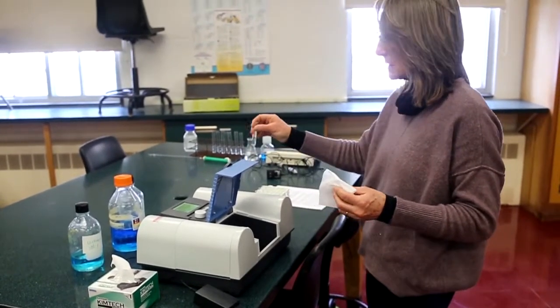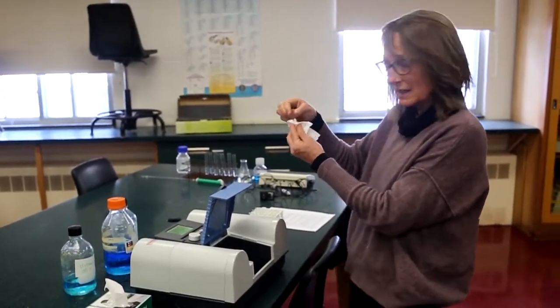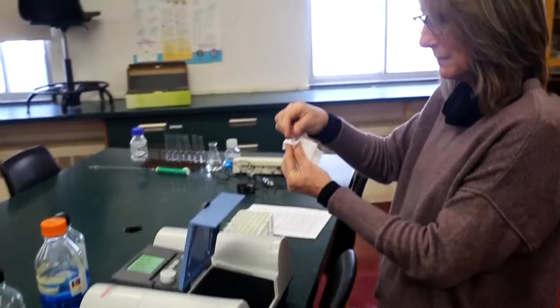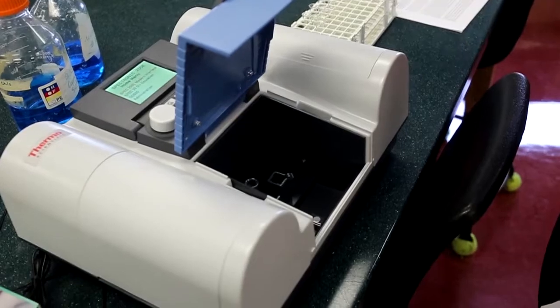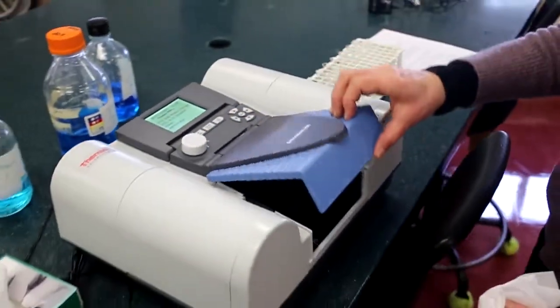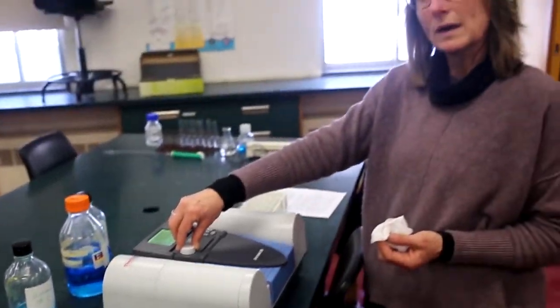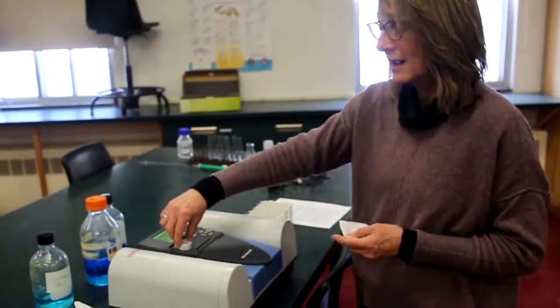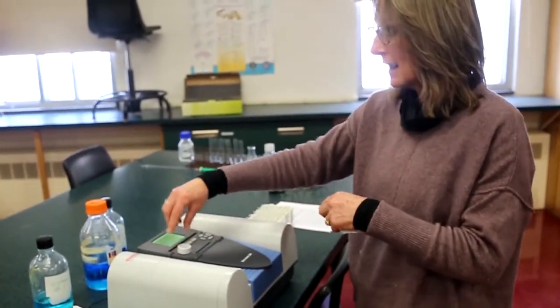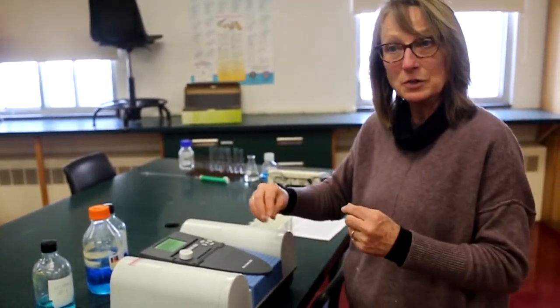So what we're going to do is place a small amount of the blue solution in a cuvette. We're going to wipe it, make sure it's clean because we don't want to get crud down in the instrument. And we're going to place the cuvette in the path of a beam of light. We're going to close the lid. We can set the absorbance at whatever wavelength we choose. And for this first exercise, we're going to choose all the wavelengths. We're going to start at around 400 and take a measurement called the absorbance. And we're going to crank it up to 450 or 500, take another measurement and keep going.